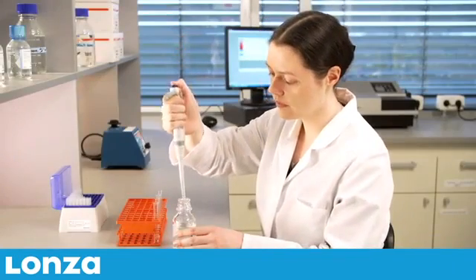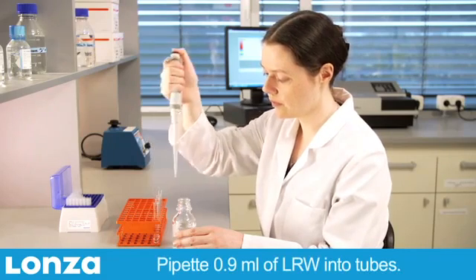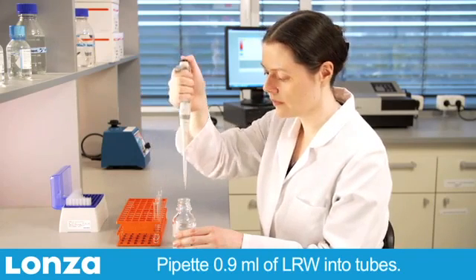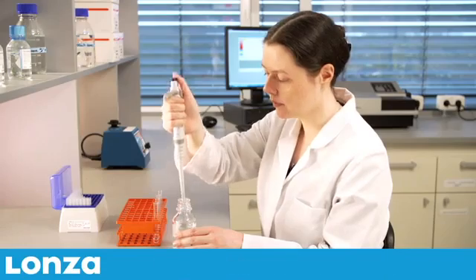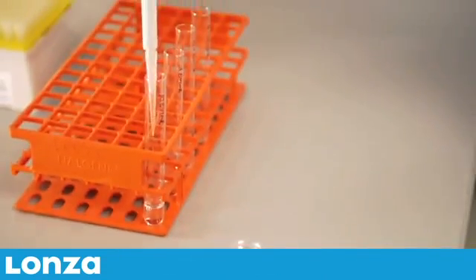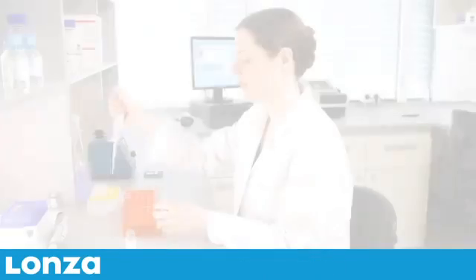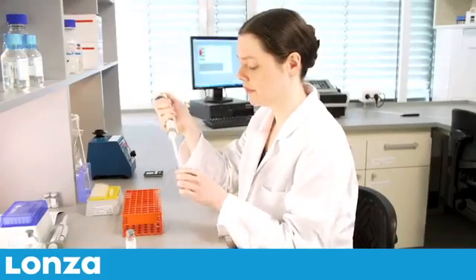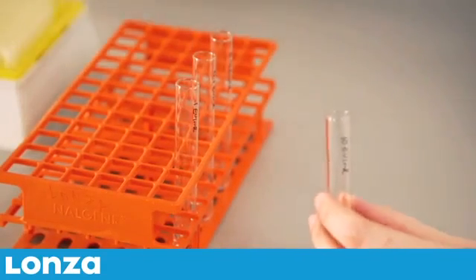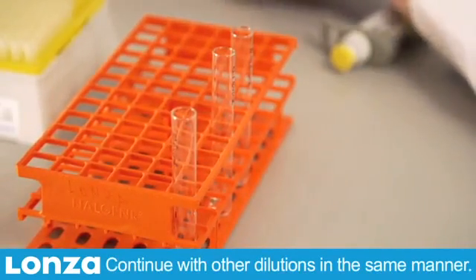Next, prepare a series of endotoxin dilutions. Pipette 0.9 milliliters of LAL reagent water into appropriately labeled dilution tubes. Take 100 microliters of CSE from the vial and add to the first tube. Vortex for one minute. Pipette 100 microliters of the solution from tube number one into the next tube in the series and vortex for one minute. Continue with other dilutions in the same manner.